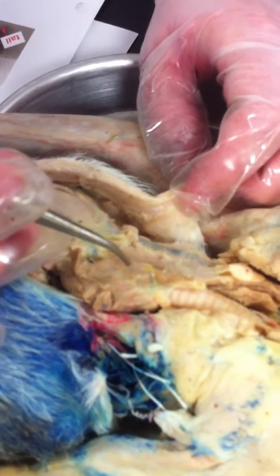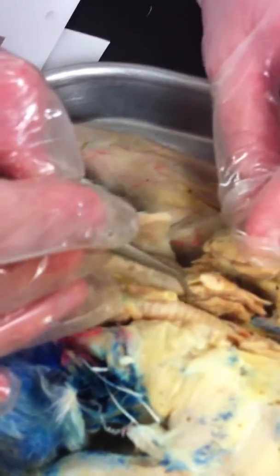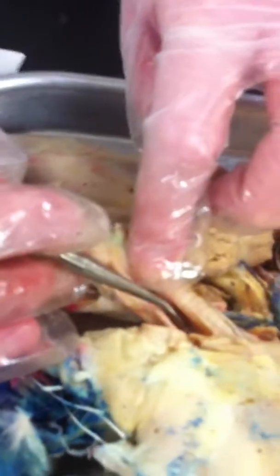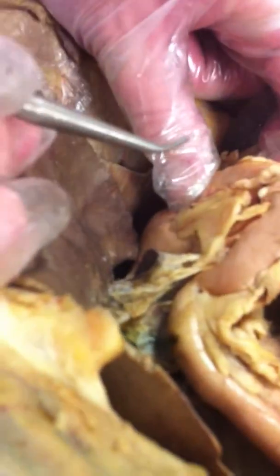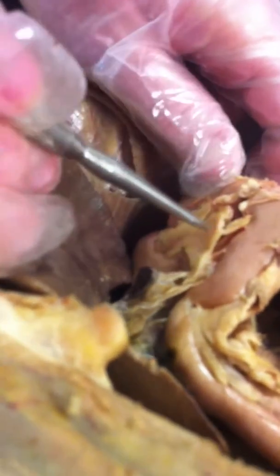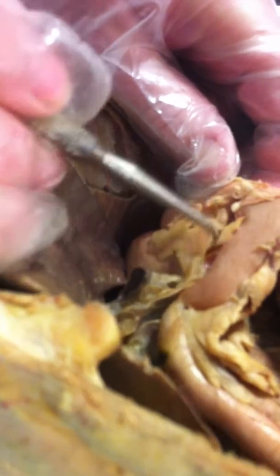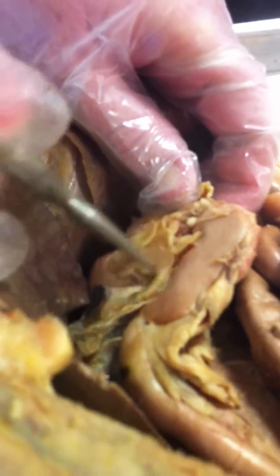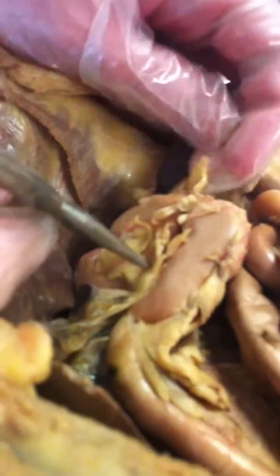What's next? The esophagus, you already saw. That was behind the trachea. Here. And it takes food down to the stomach. So my guess is the stomach is the next thing we're supposed to see. Greater and lesser omentum are next? Okay. The stomach has two curves. This one's called the lesser curvature. This one's called the greater curvature. This connective tissue with the fat in it is called the lesser omentum, because see how it's stuck to the lesser curvature of the stomach?